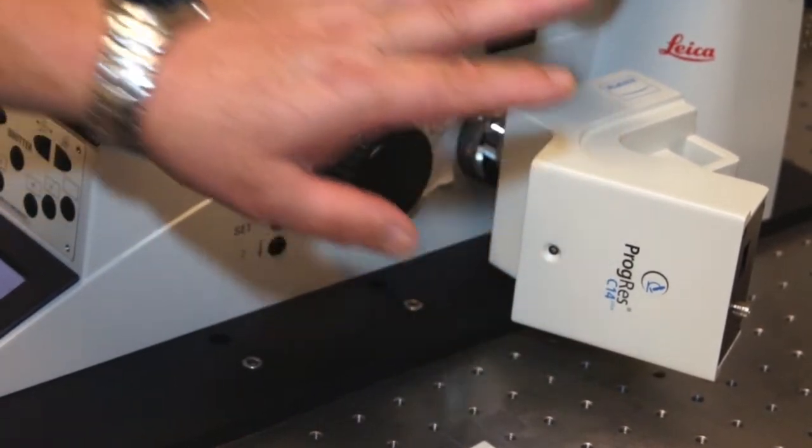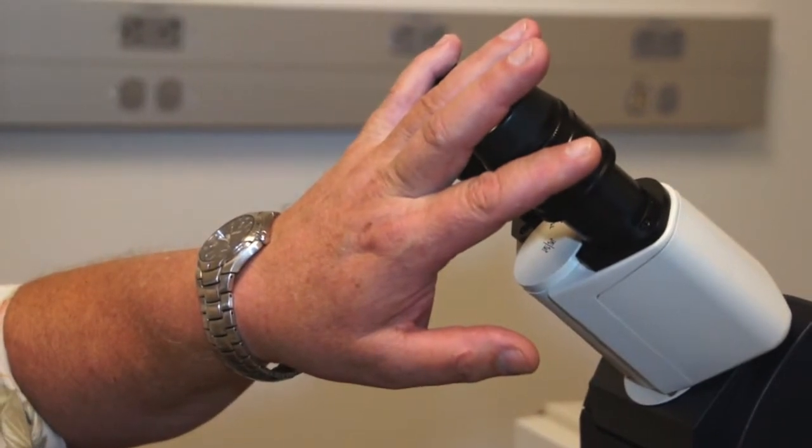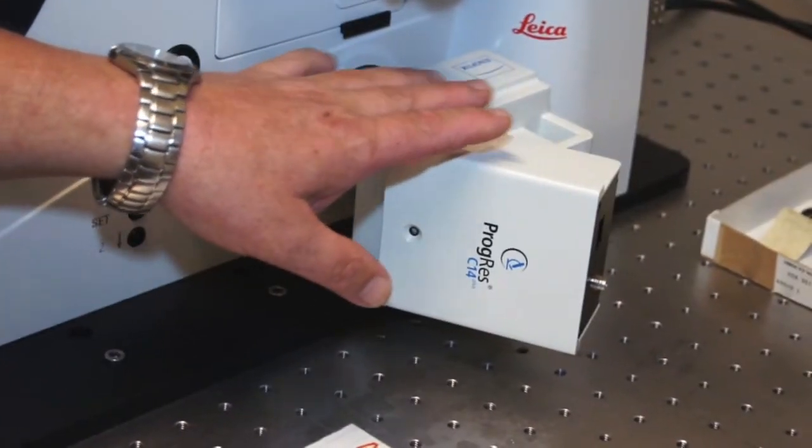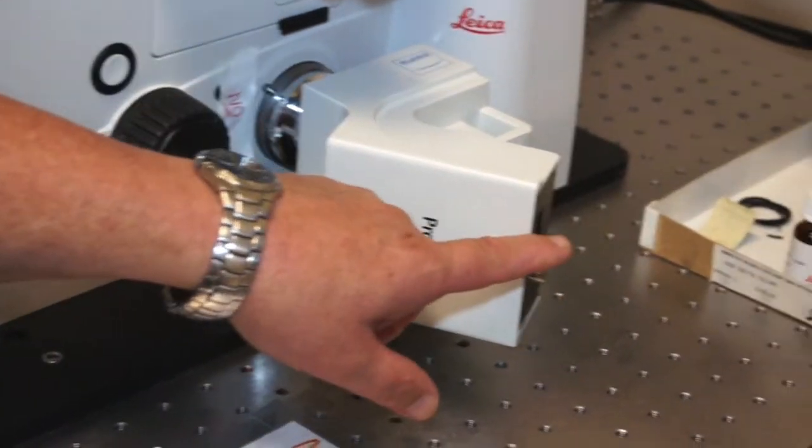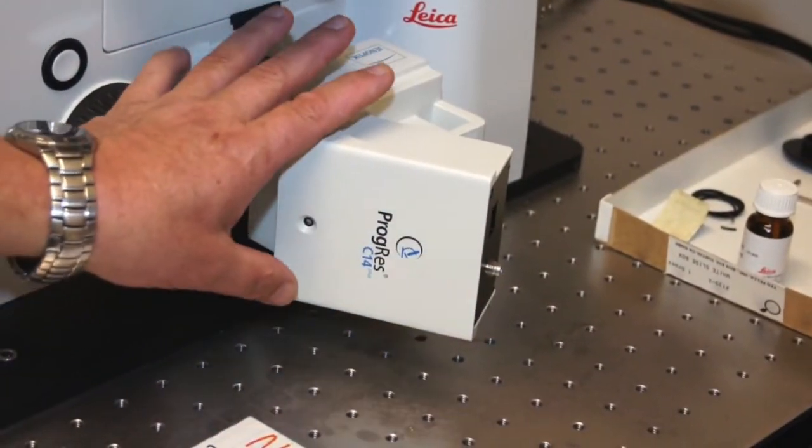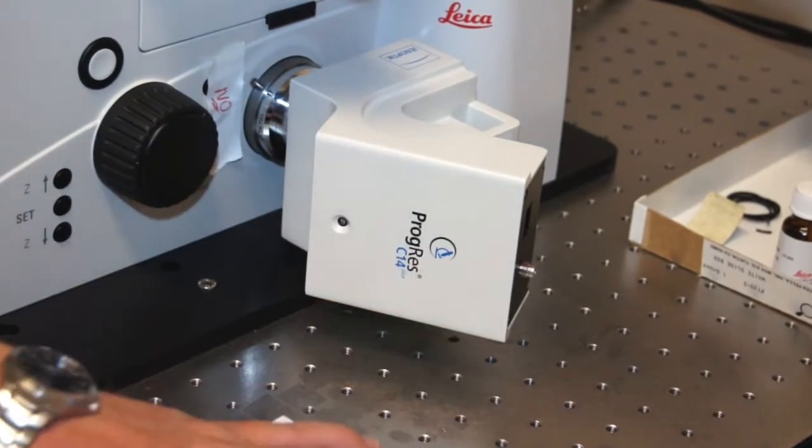We can direct the beam path to go from the viewing port down to the camera port. By connecting this to a laptop via a firewire cable, we can take pictures right off the microscope right onto a laptop.